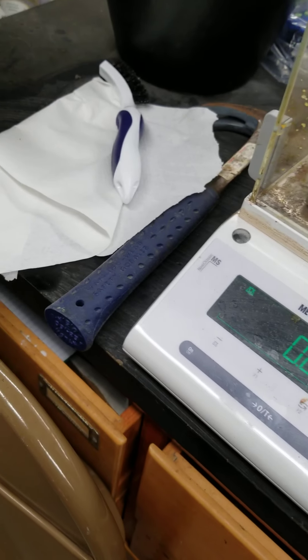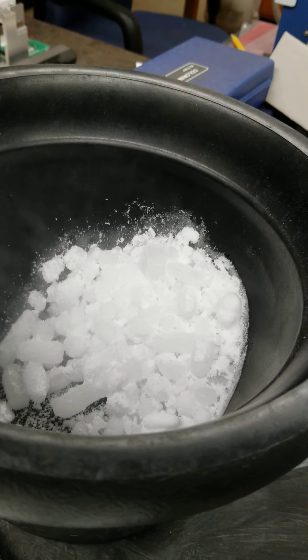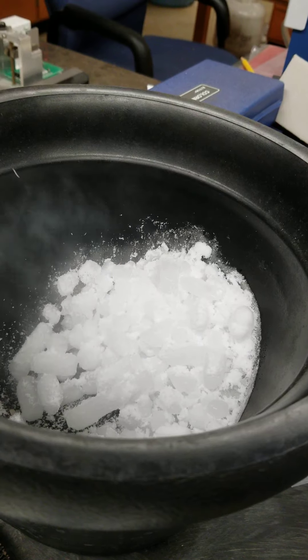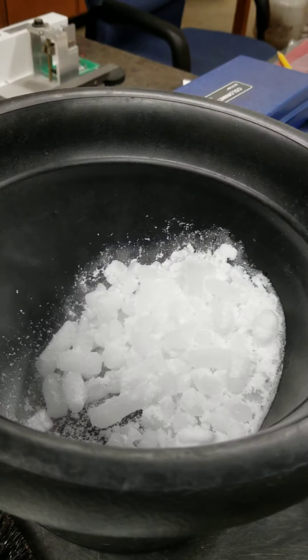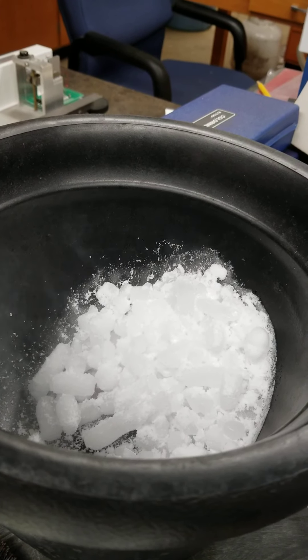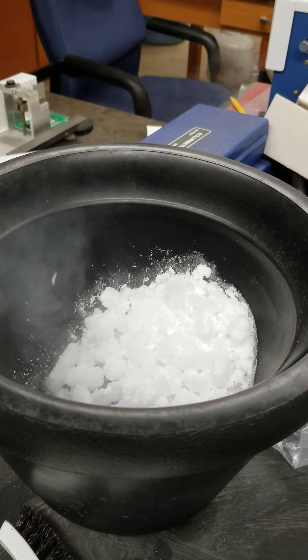Our experiment has been highly compromised by the quality of our dry ice. When I did this experiment originally, I had big chunks — I could break them and get away from any surface contamination, get the middle portion and throw it in, and the results were more reliable that way. Here, our dry ice is highly compromised by serious water absorption. I was looking in the freezer where I got this dry ice and realized it had been there for the last month or two, so it's highly compromised. You get values not as good as I had in the pre-lab, but at least you get an indication of how to do the experiment.